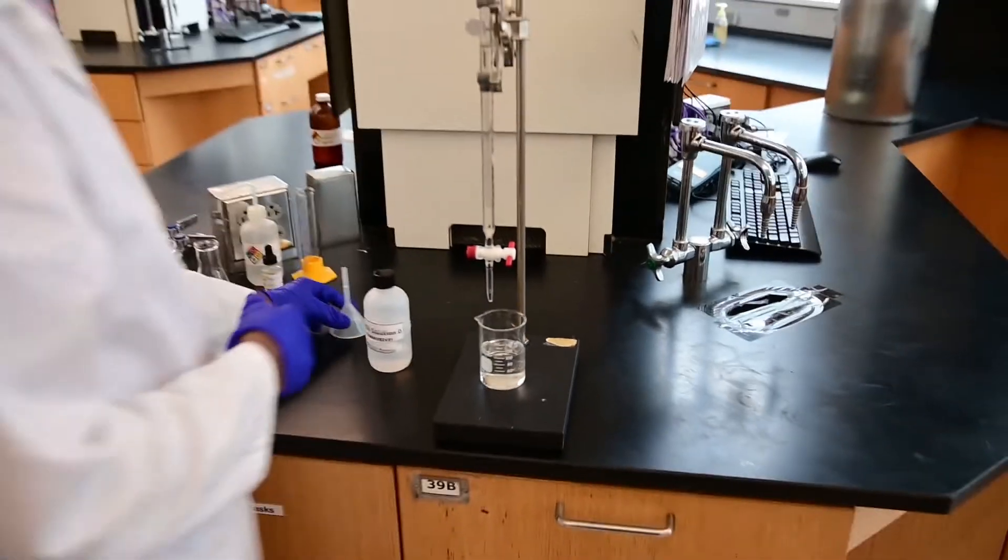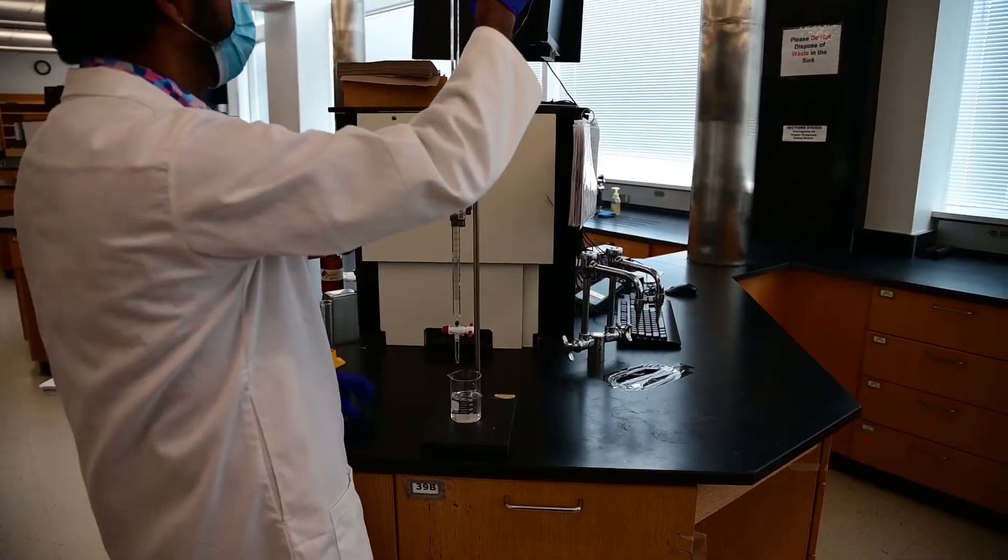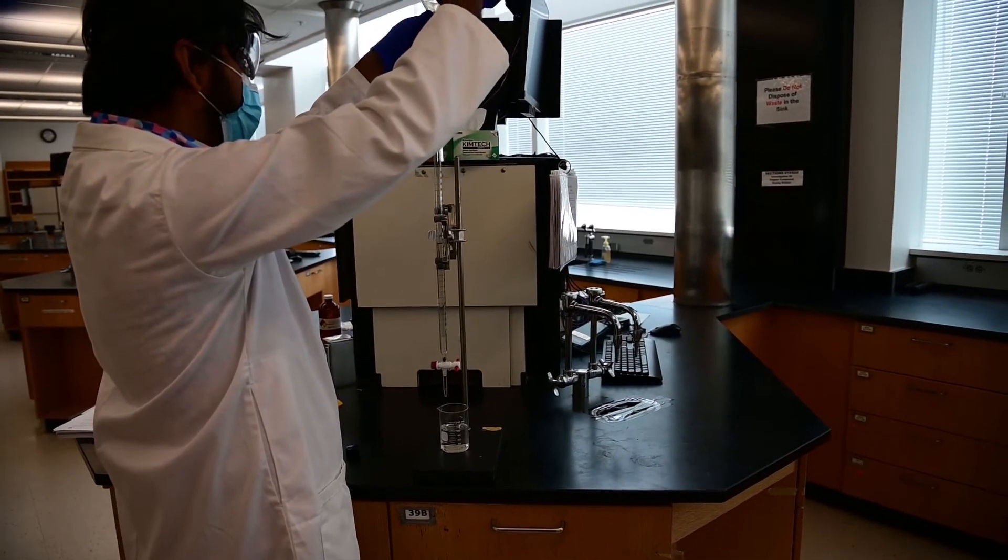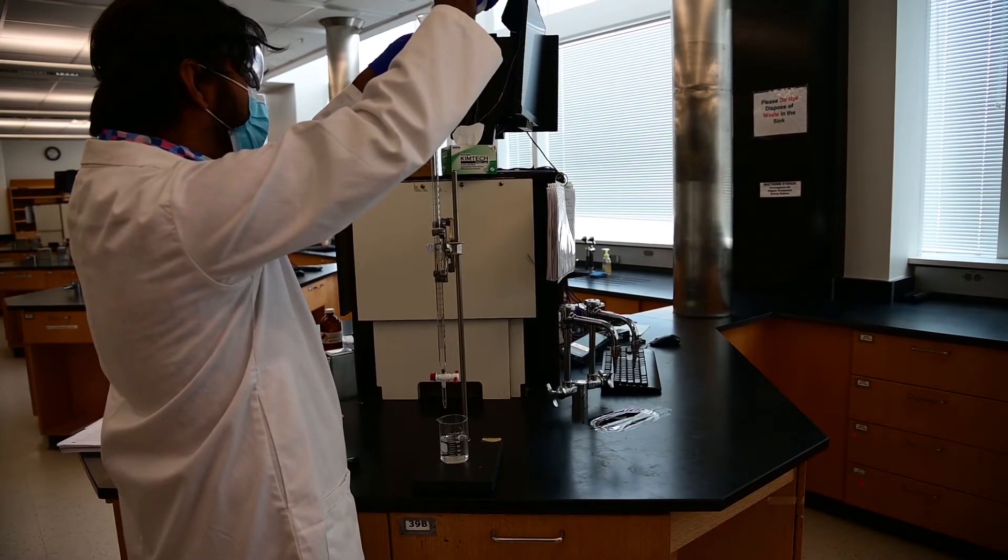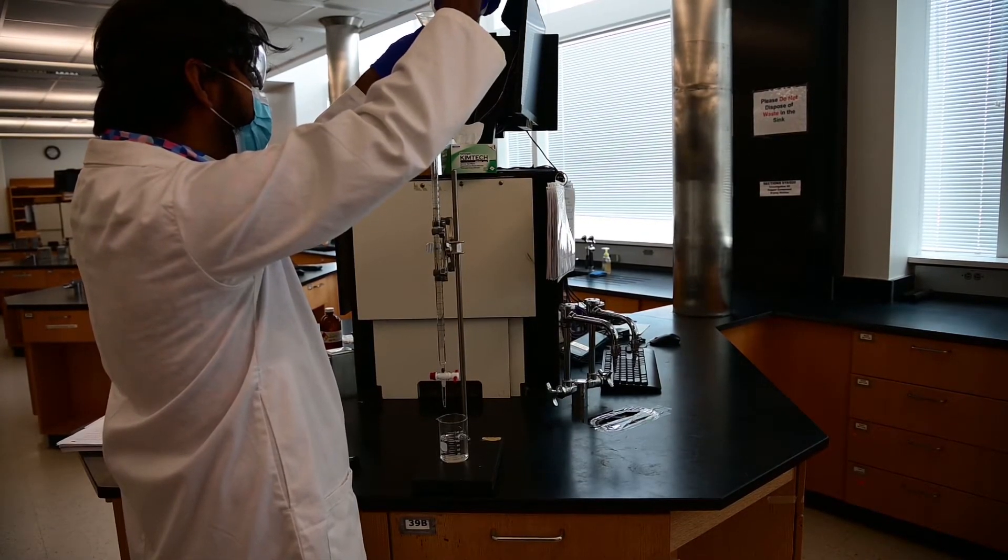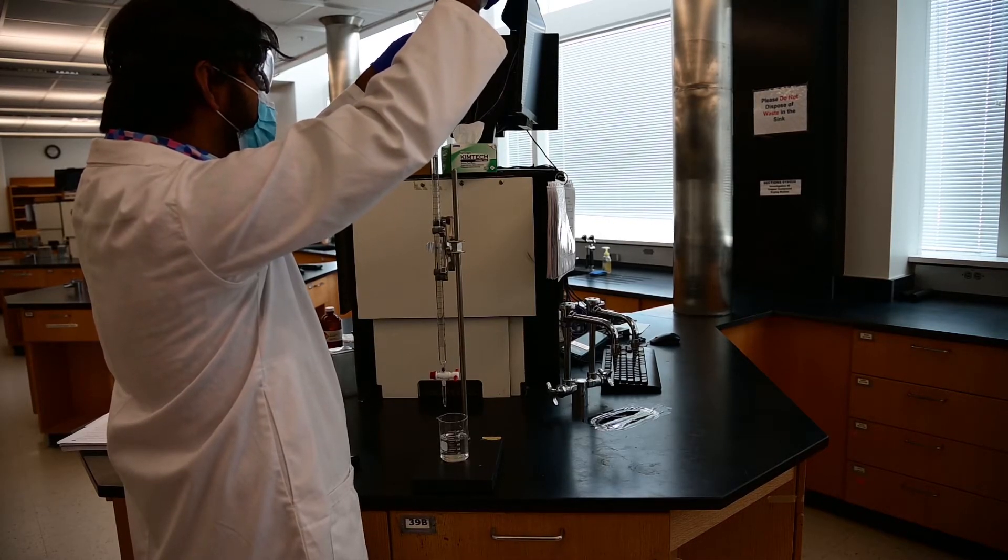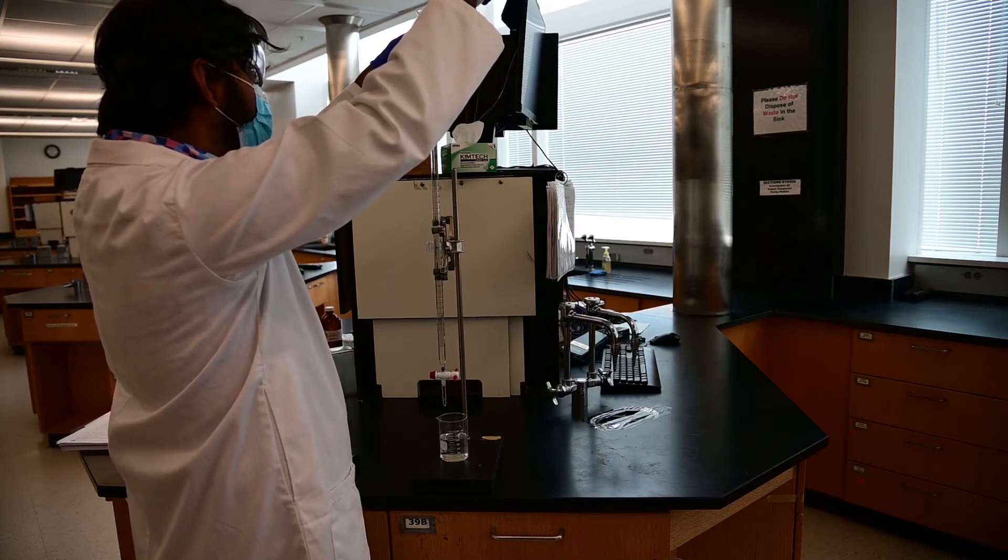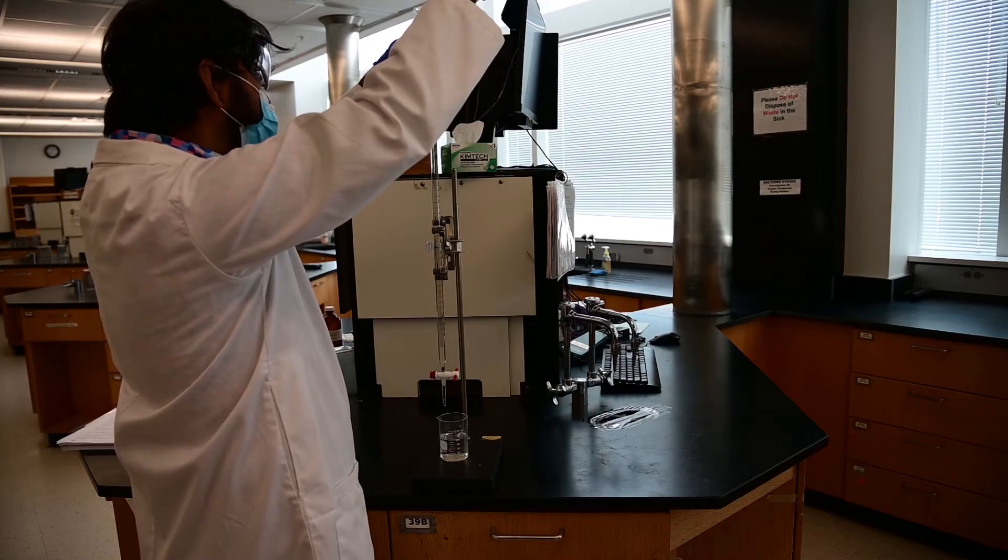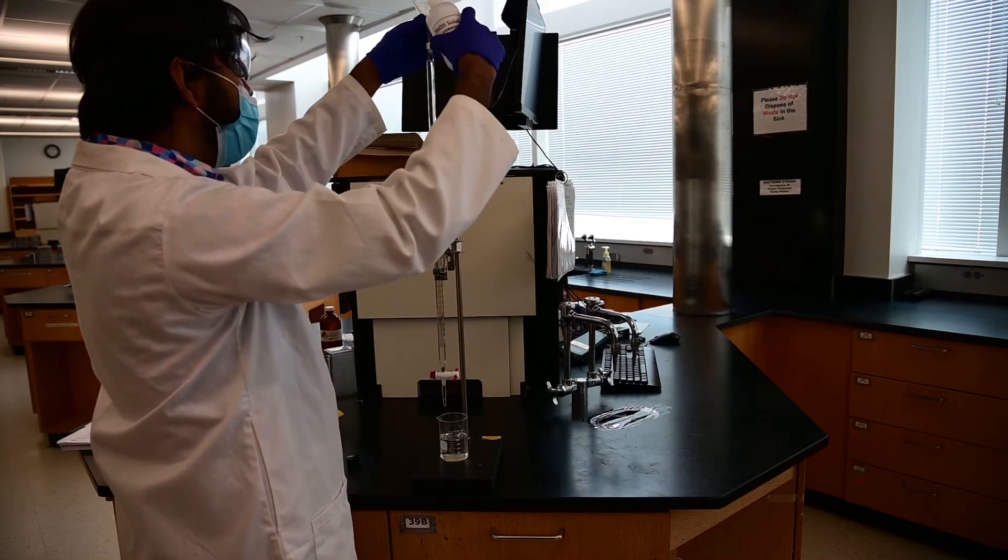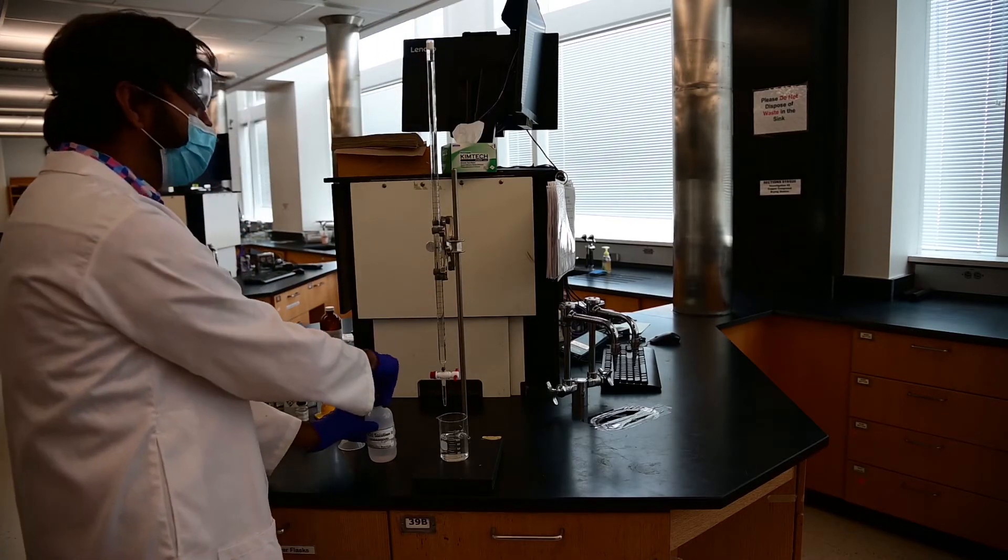So now we will fill it up to the zero mark. Once you can make sure the tap is closed. Otherwise, as you are filling it, it will also dispense at the same time. Incidentally, you do not have to always start with exactly the zero mark. As long as you can read the burette and you know your initial reading, you should be fine.